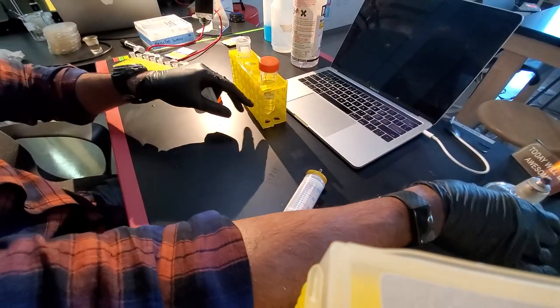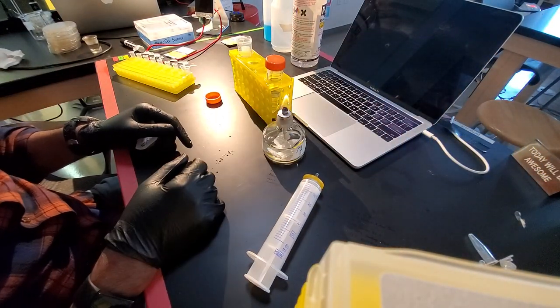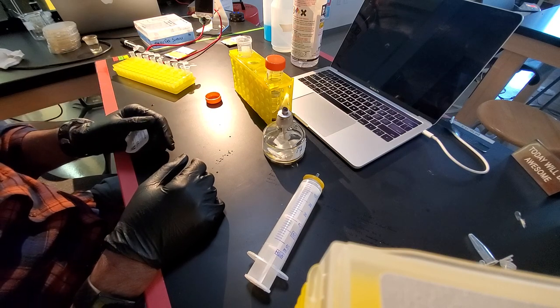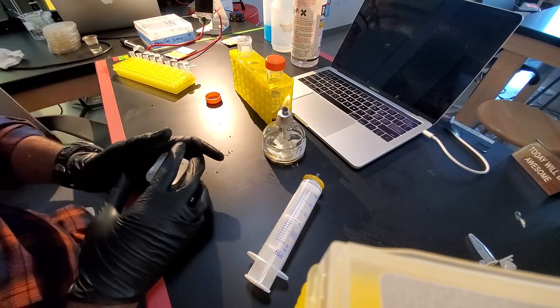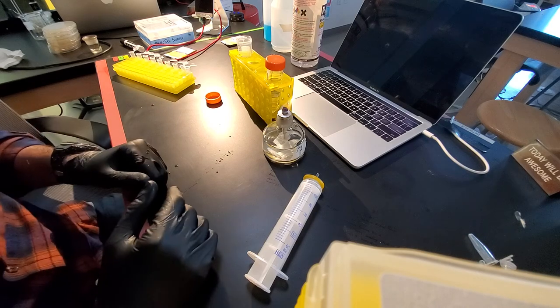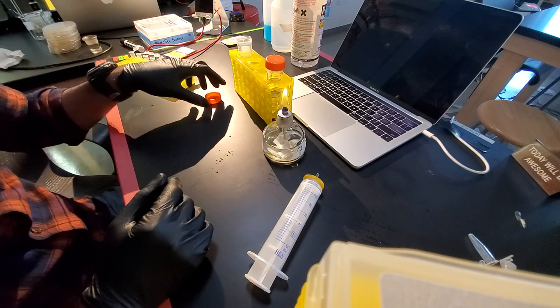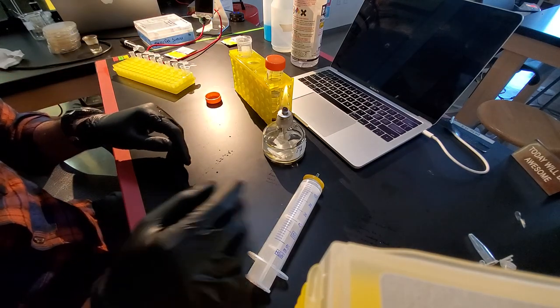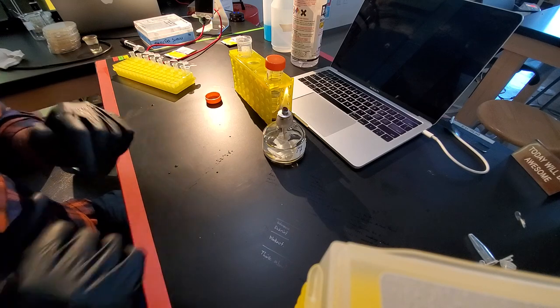You can, if you want to, use a flame while you're doing this to keep an updraft. I'm not super concerned about it. This is ampicillin. So it's going to pretty much kill most of the bacteria or anything it comes in contact with anyway. That's it.